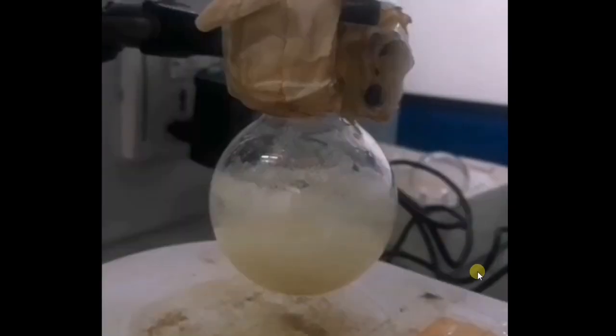After this I crush bromobenzaldehyde that was hard, and then I add acetophenone in ethanol in which base was already present. After 10 minutes I add benzaldehyde that I crushed in mortar and pestle because it was hard.